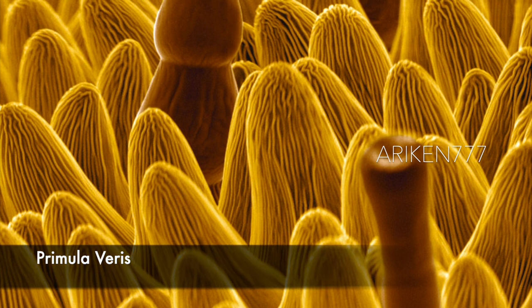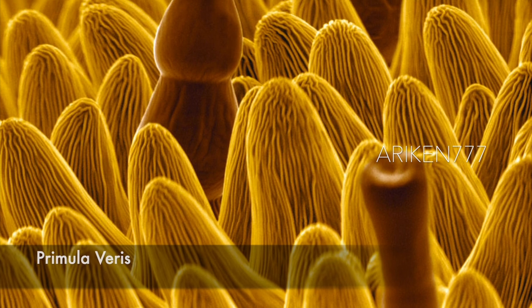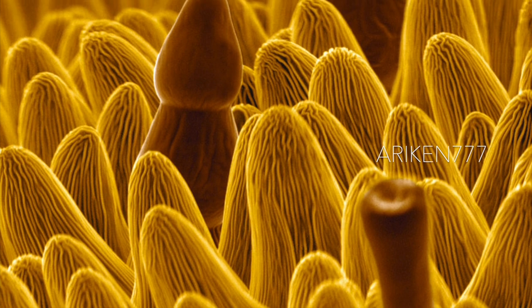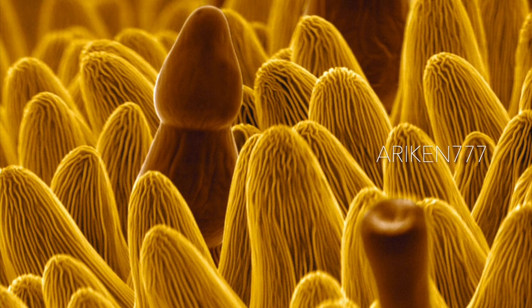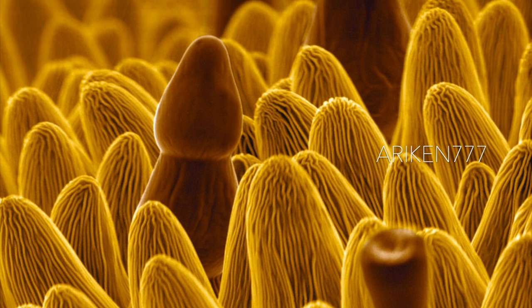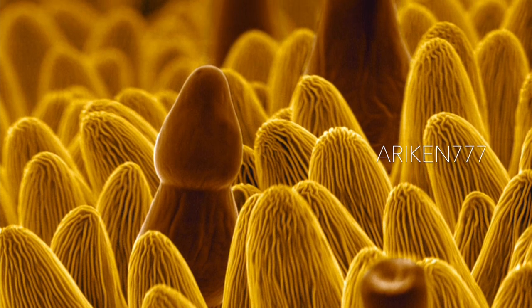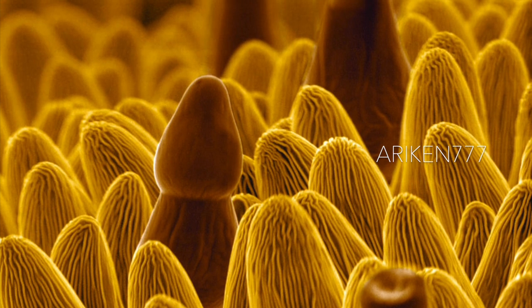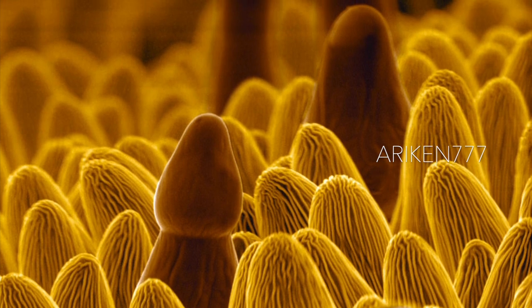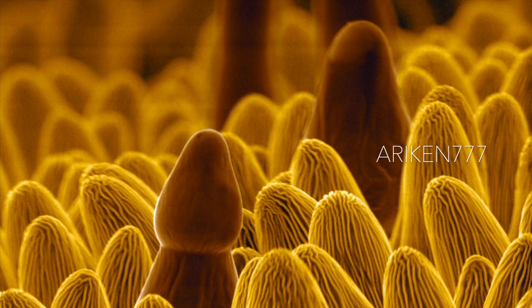The surface of a Primula veris, or cowslip, petal. In this image we can see the yellow conically shaped cells of the primrose flower's petal, along with the trichomes which are the brown multicellular hair. Flowers and leaves of the primrose have medicinal qualities — they are used as a salve to treat inflammation and as a tonic for coughs and common colds.